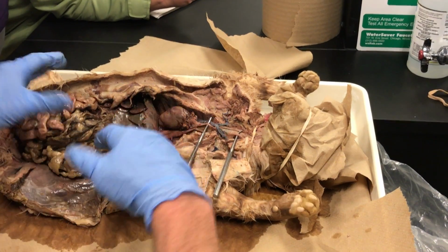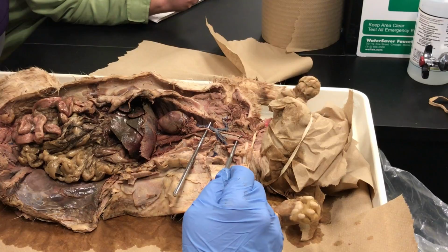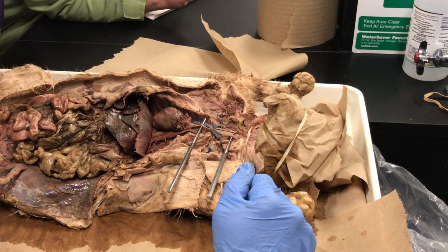And I'm not going to do lefts and rights on any of these vessels. There's only one vessel that has a left as part of its title. Everything else you don't have to worry about lefts and rights on. And the same on the chart.